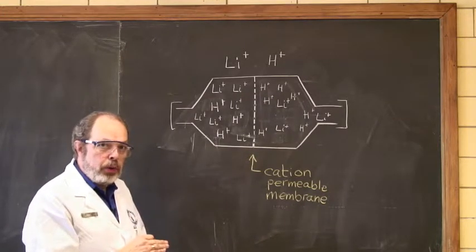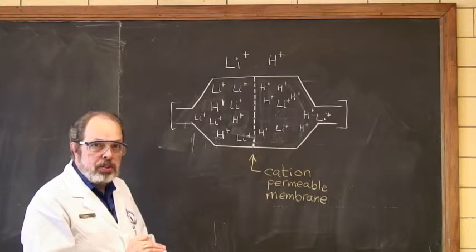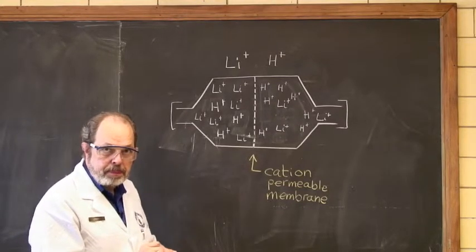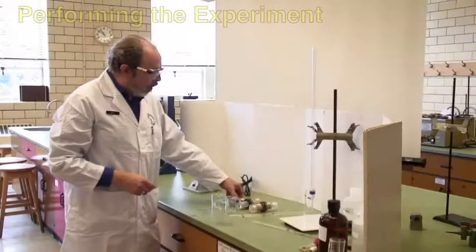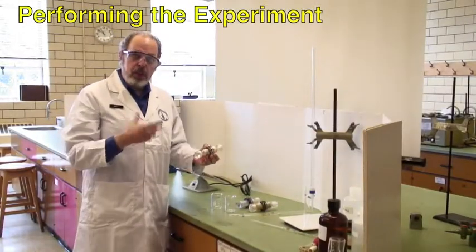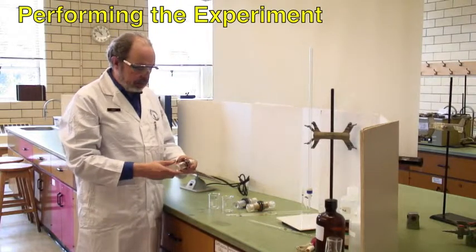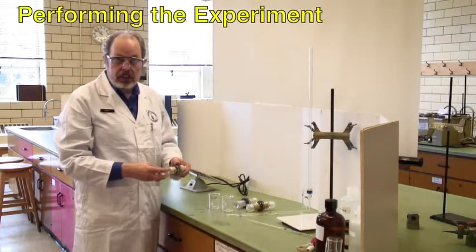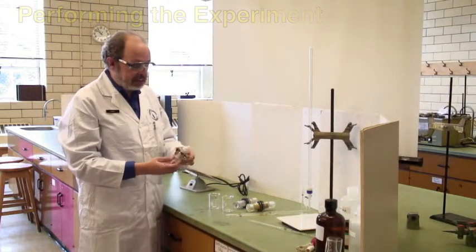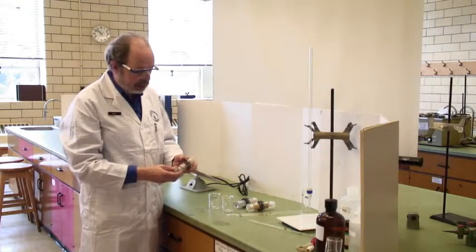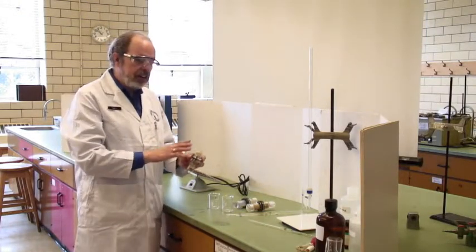So much for the theory of what we're doing. Let's go back to the instrument and do the practicalities. We've got several cells here, and you'll be using several at the same time. The first thing you're going to need to do is to condition the cell.